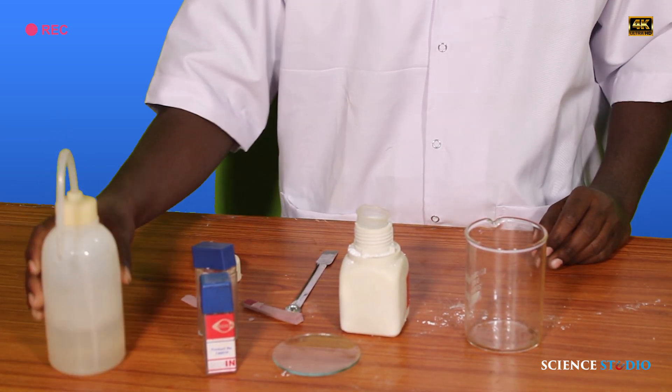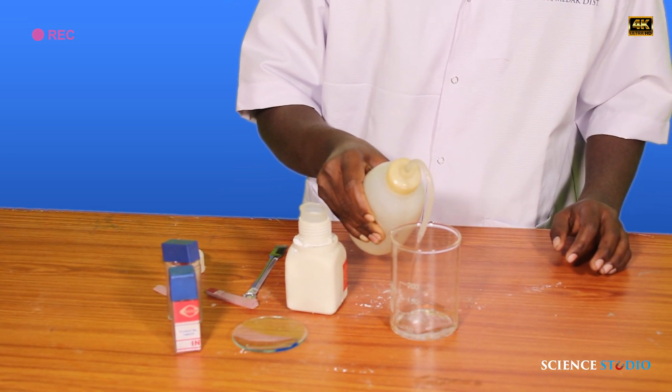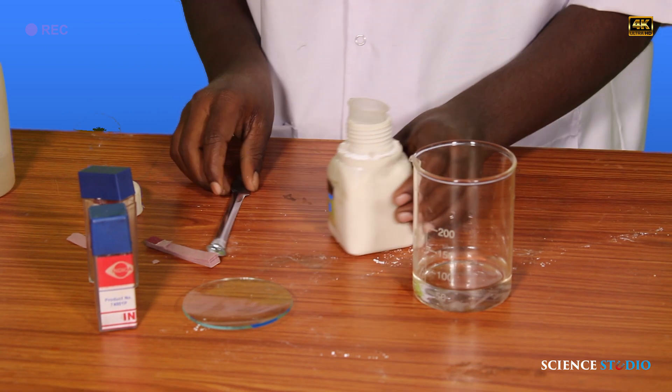We also need a watch glass and distilled water. Before performing the activity, let us discuss the properties of calcium oxide. Calcium oxide is a white crystalline powder and is sparingly soluble in water. It is very irritating to our eyes, skin, and mucous membrane. It is used in insecticides and fertilizers. It is hygroscopic in nature and has a cubic crystalline structure.